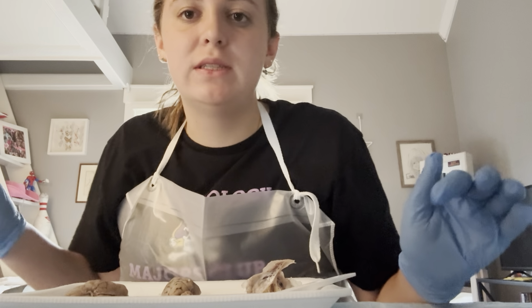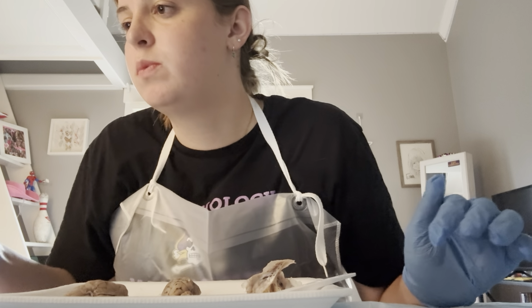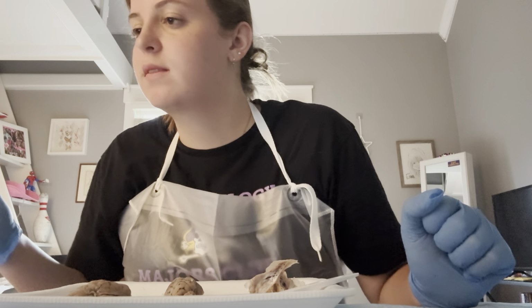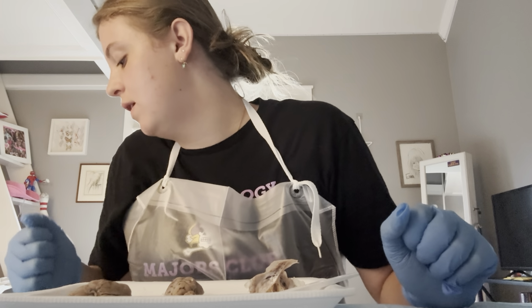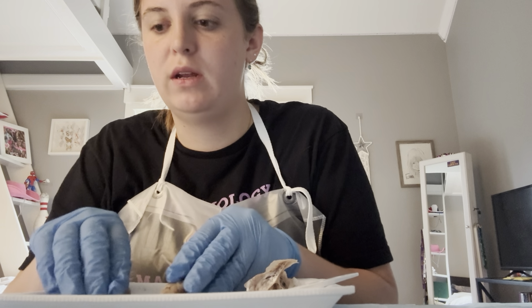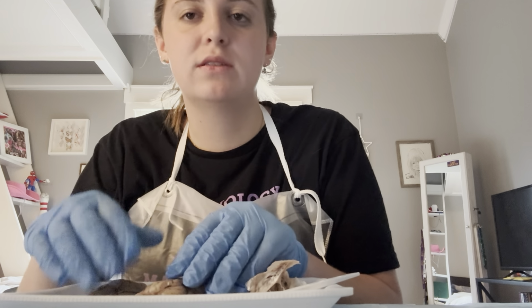And then now I'm going to clean off everything, wash my tools with soap and water, disinfect them, and then throw out the brain in the correct location.